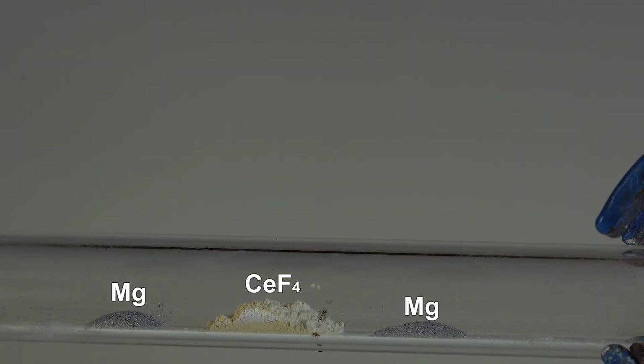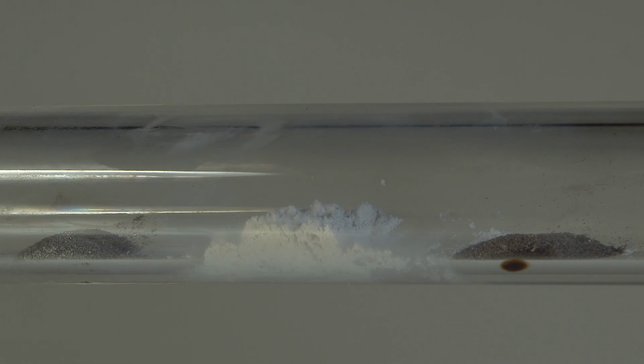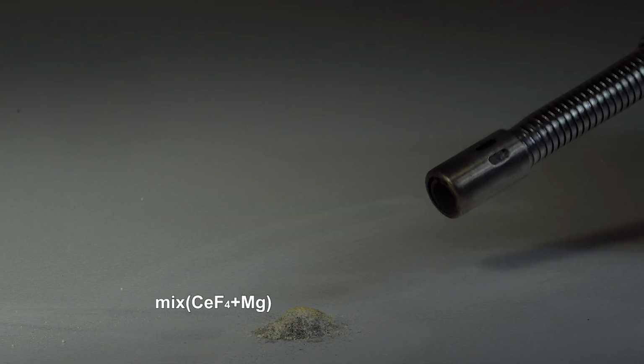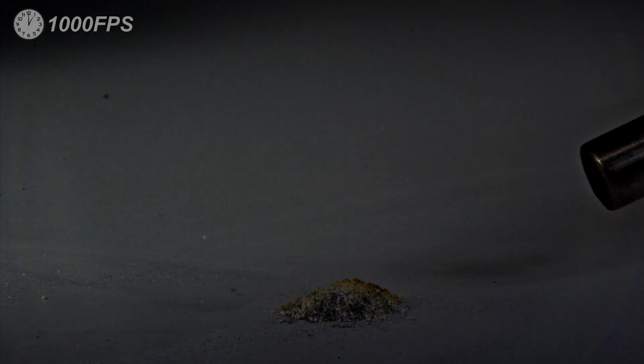When it was decomposing, I failed to ignite magnesium the way I did in the experiment with manganese trifluoride. Maybe it has something to do with a very high decomposition point of cerium tetrafluoride as compared to that of some other similar cobalt and manganese compounds. On the other hand, the reaction of cerium tetrafluoride with magnesium looks pretty appealing in slow-mo.